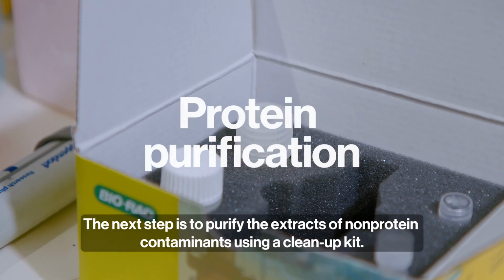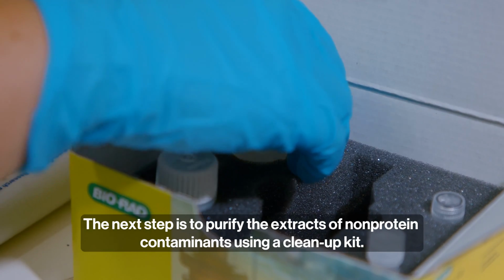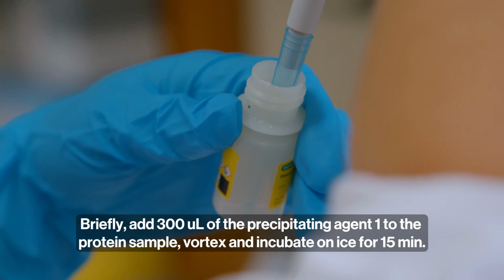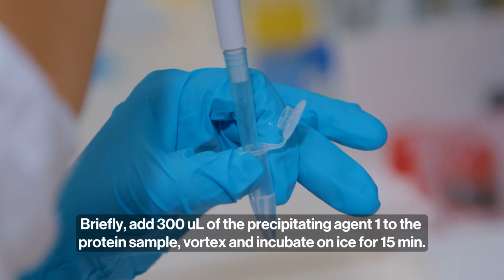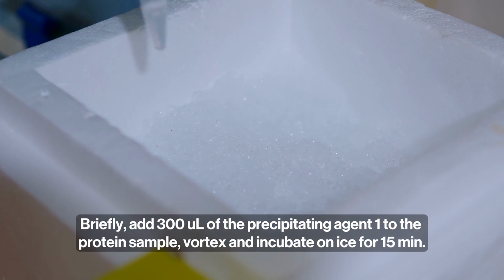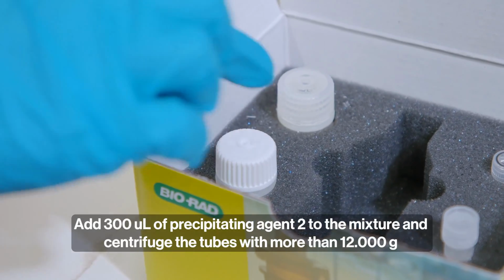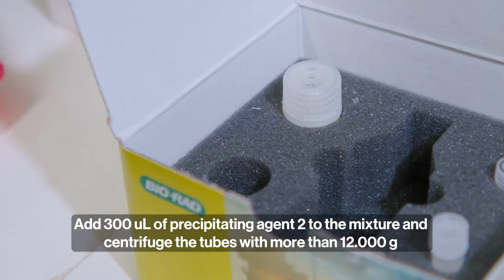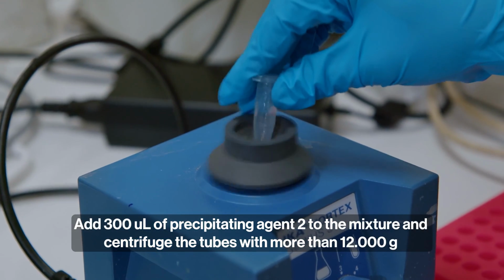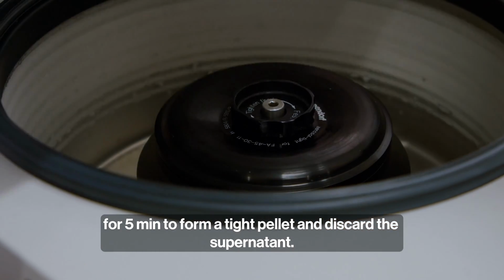The next step is to purify the extracts of non-protein contaminants using a cleanup kit. Briefly, add 300 microliters of the precipitating agent 1 to the protein sample, vortex and incubate on ice for 15 minutes. Add 300 microliters of precipitating agent 2 to the mixture and centrifuge the tubes with more than 12,000 Gs for 5 minutes to form a tight pellet and discard the supernatant.